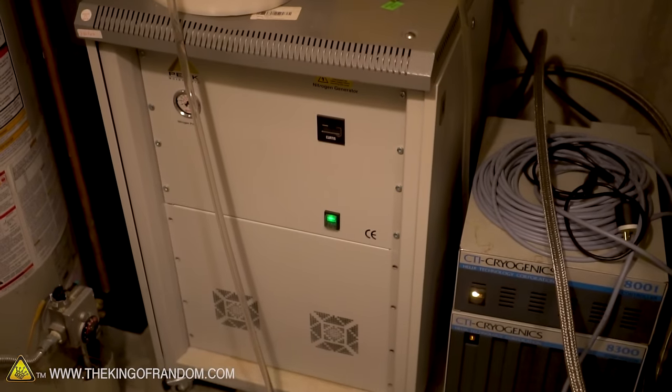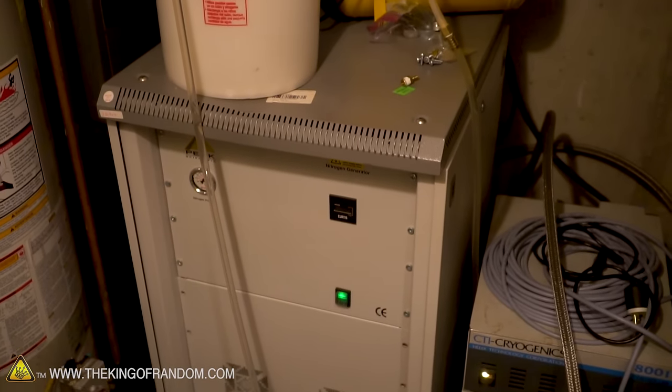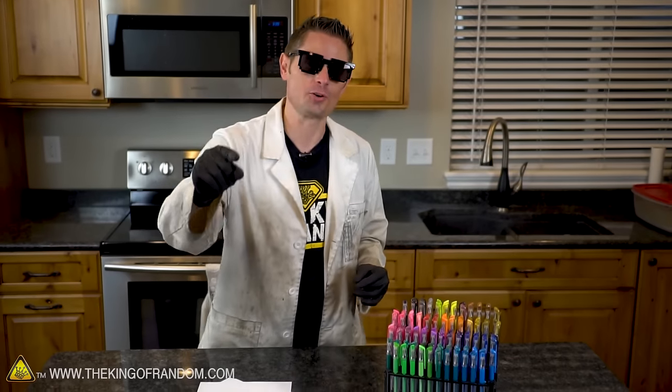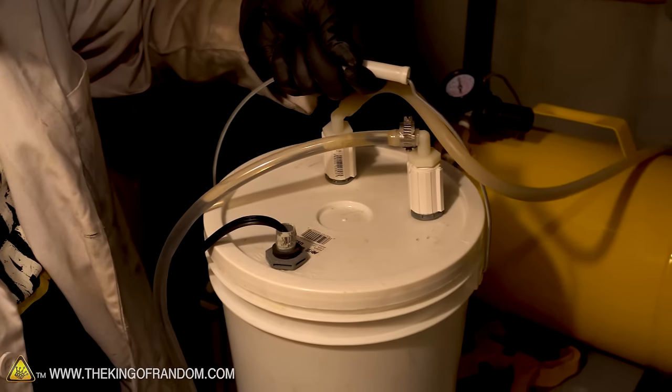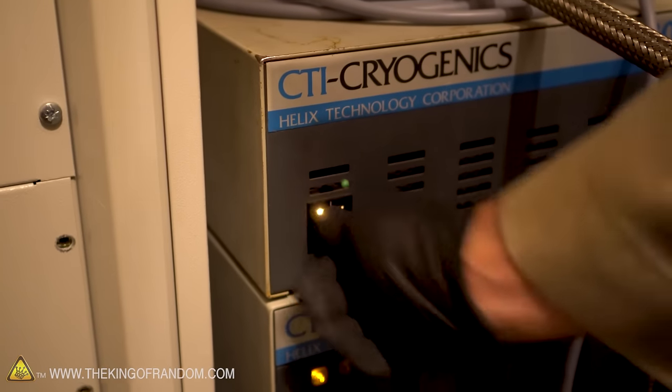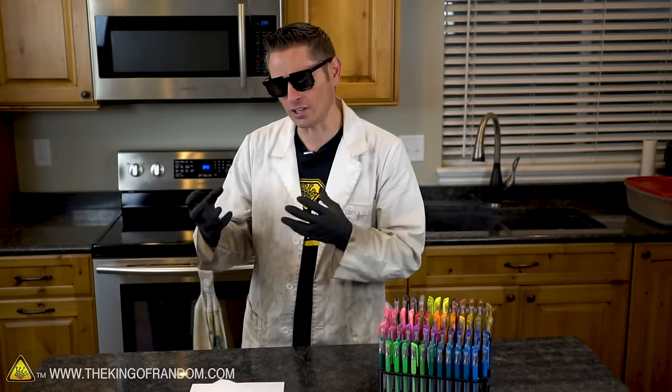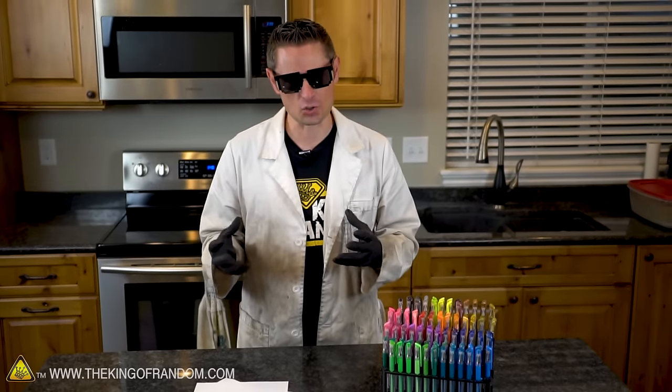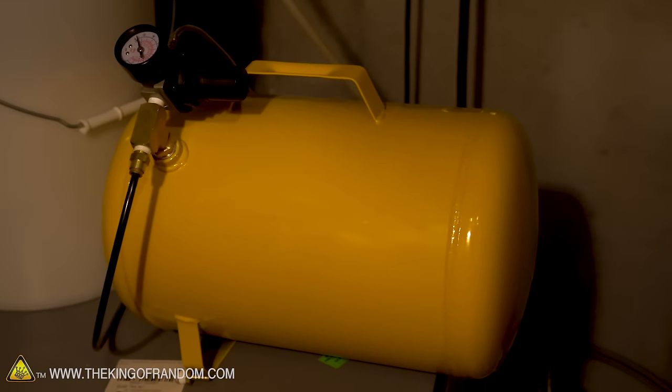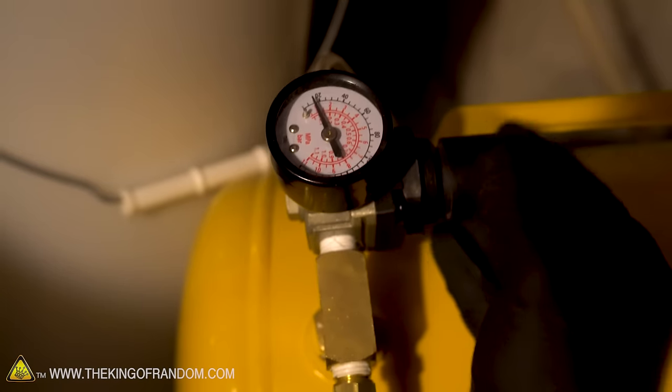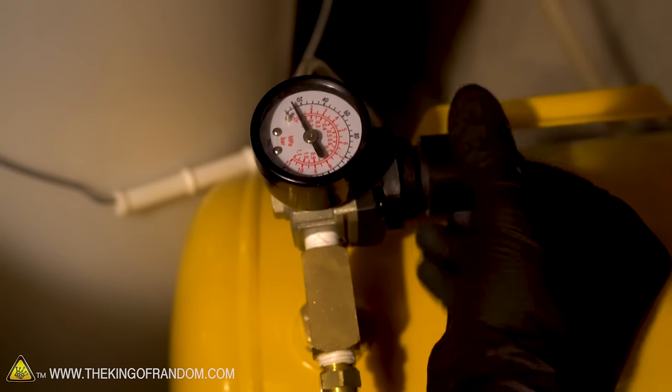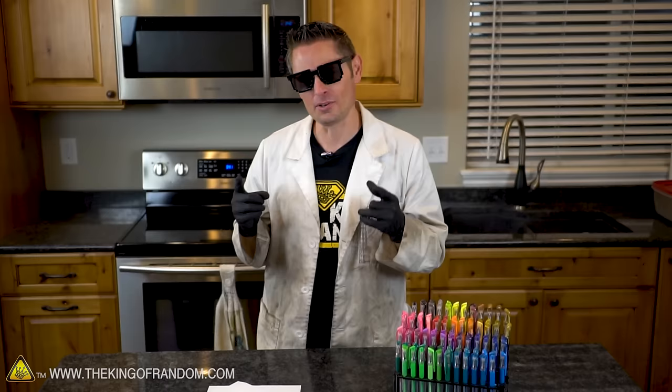In one of the secret compartments of my room, I have this nitrogen generator that does all that for me. And I really have to give credit where credit's due to my friend Chris Roberts, who really made all this possible. He's the one that located all the items, he sourced all the equipment, he helped put it all together, and he helped get it to the functioning state that it is today. Now once we've got the clean, dry nitrogen gas, we need a place to store it. My friend Chris went down to Harbor Freight and picked up a little tank for about 20 bucks that we use to store that nitrogen gas under pressure. And we added a little regulator so we can turn a knob and regulate how much gas flows out.